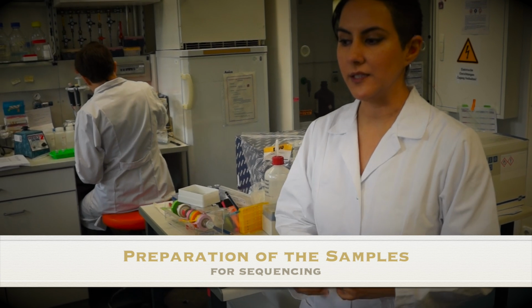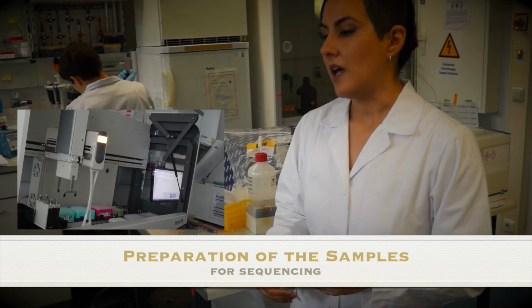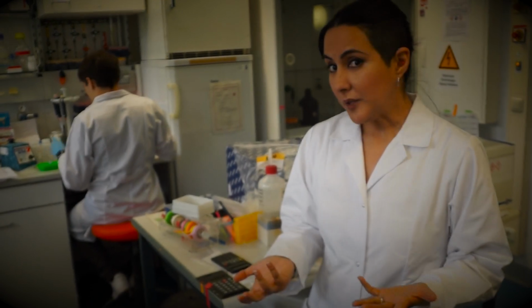Where we mostly start the process of extracting the DNA and preparing for the PCR and indexing PCR, for example, when we want to do amplicon sequencing of the 16S region of the microbes. So we process here all kinds of different samples.